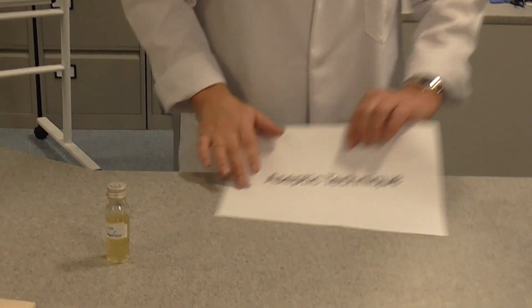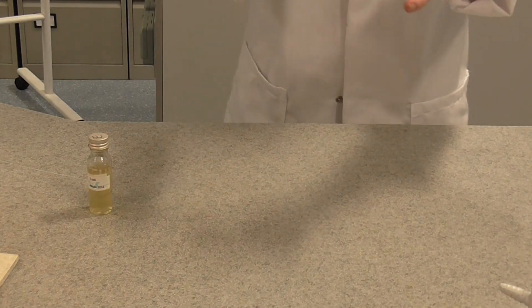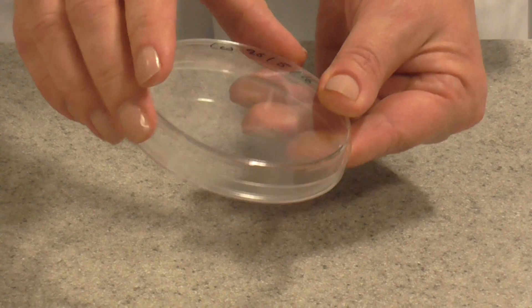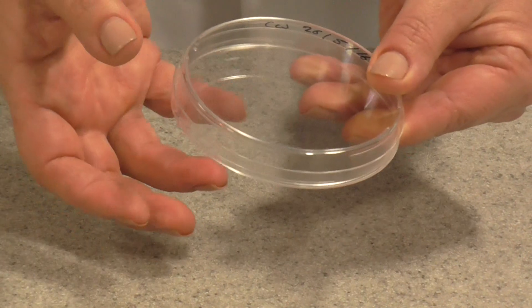The first thing we're going to do is to actually take a sterile Petri dish. You're going to turn it upside down and put your initials and date the base. This is standard practice because in a microbiology lab you wouldn't be sealing the lids, and if the lids go missing, you need to know what's growing on there.